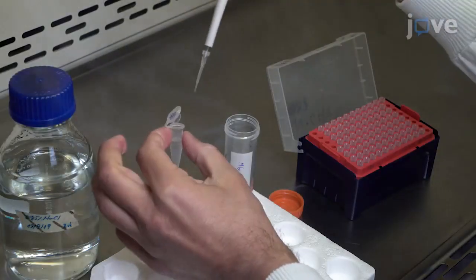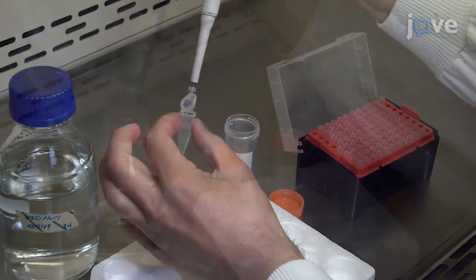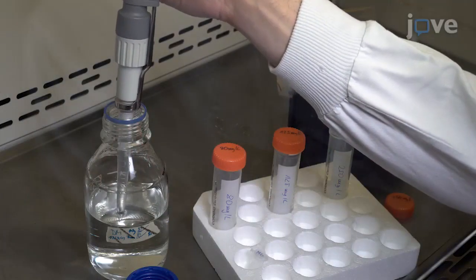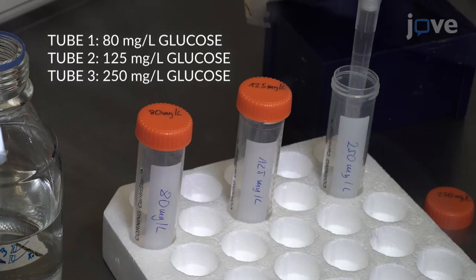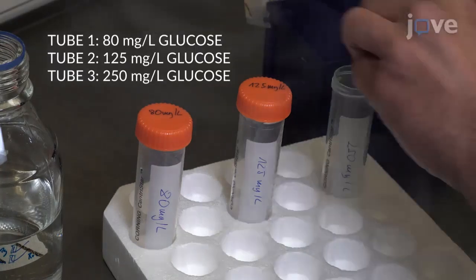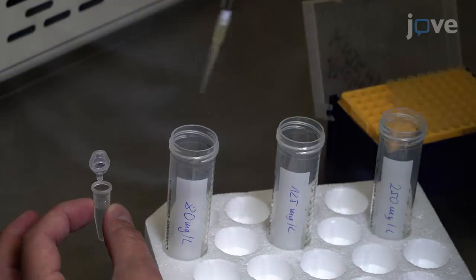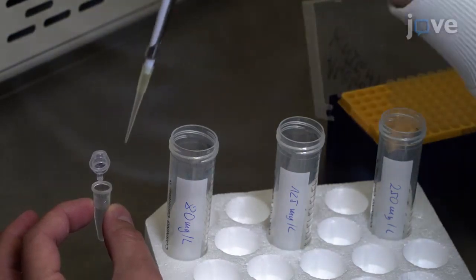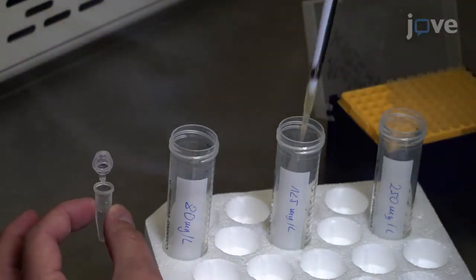After this, dilute the culture 2000-fold with a saline solution. Add 10 milliliters of liquid Davis minimal medium to each tube, with each containing a different concentration of glucose as shown. Then add 100 microliters of the diluted culture to three 50-milliliter screw-cap conical bottom polymer tubes.